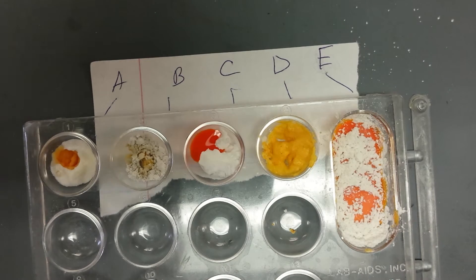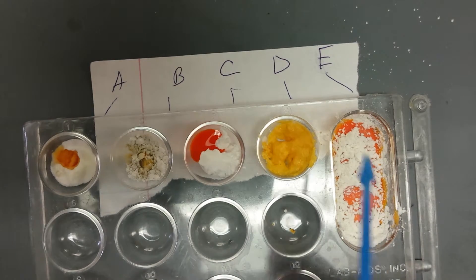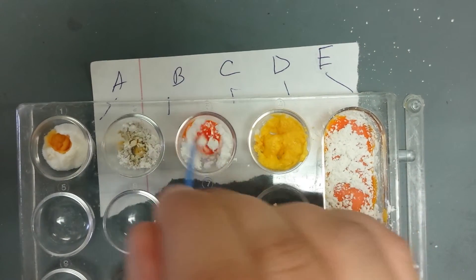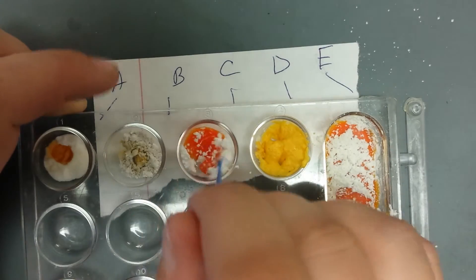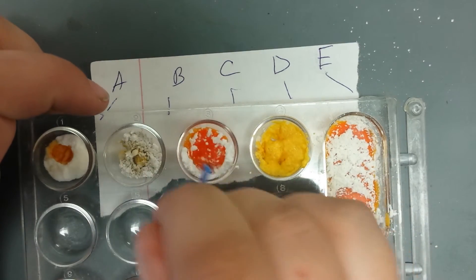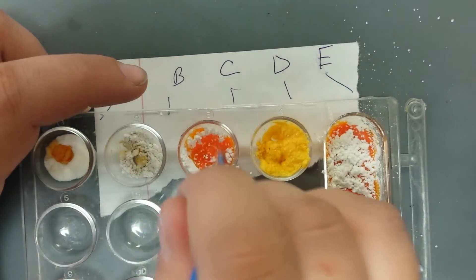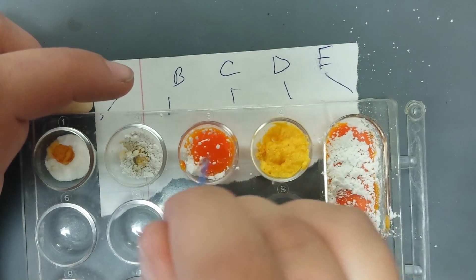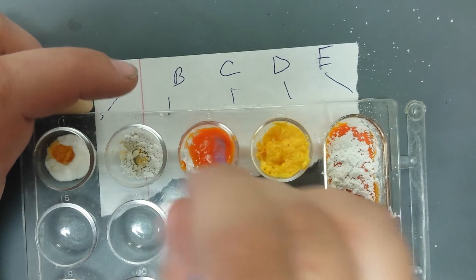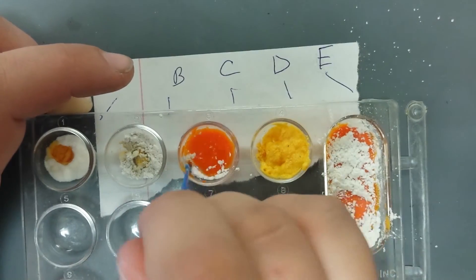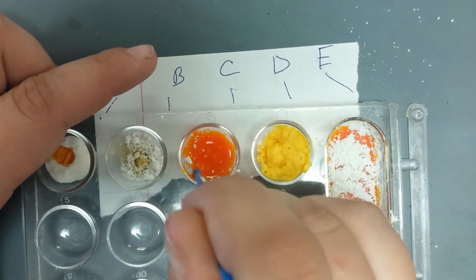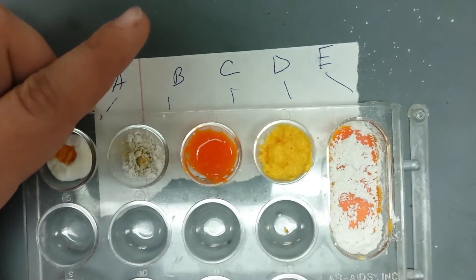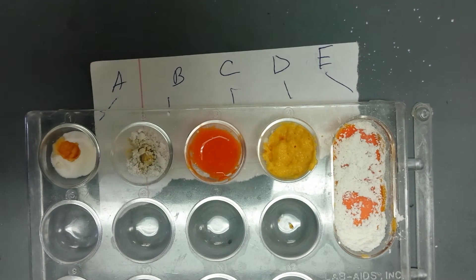Okay do we want to try, what'd you call it? C? See if we can make it mix? Cause C is the weird one. It is. And it just dissolves into everything. So you have to mix it before it dissolves. And it's like a really dark orange. It turns into paint, like a paint texture. That's what I would describe it as. So I'm C right? Yeah. It turns like white orange. When mixed.